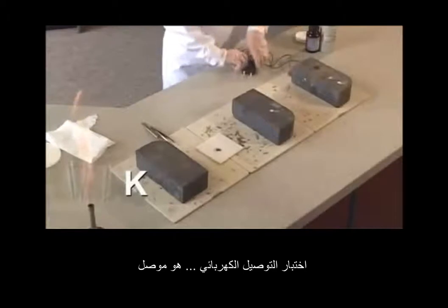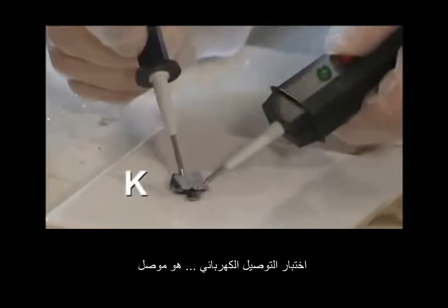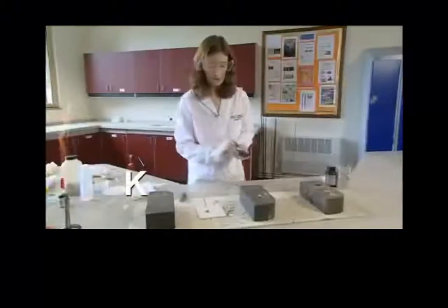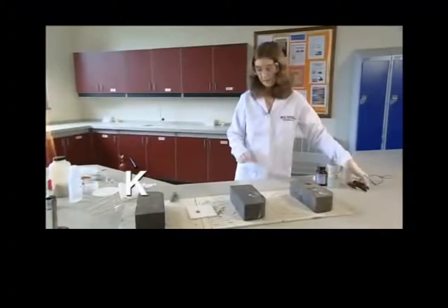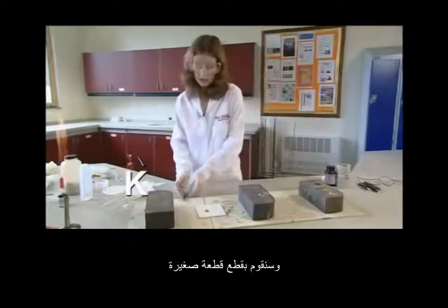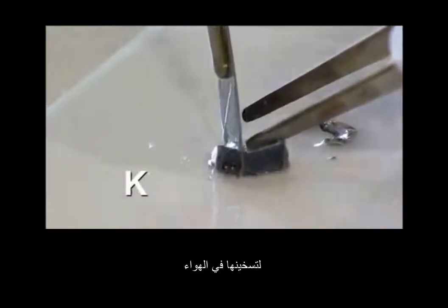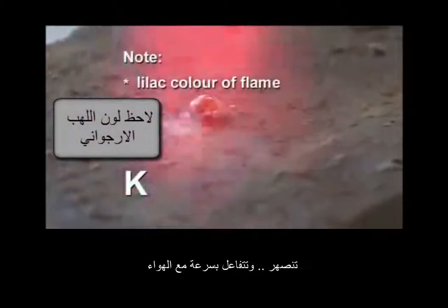Again, we can use a circuit tester to show clearly that it conducts electricity. And then we need to cut off a small piece to heat it in air. Very quickly melts. Just see a purple flame.